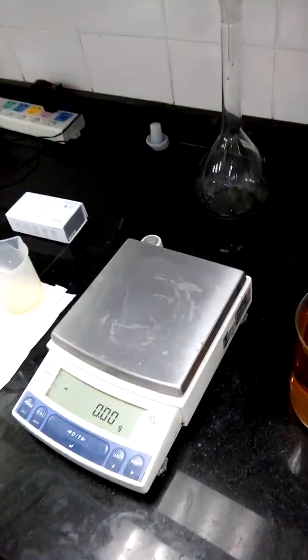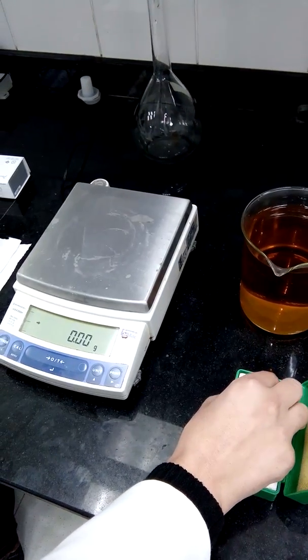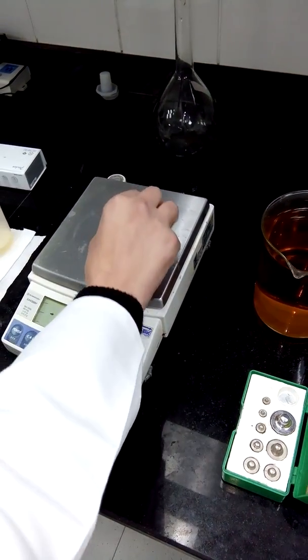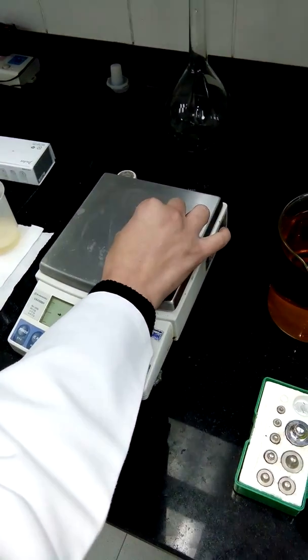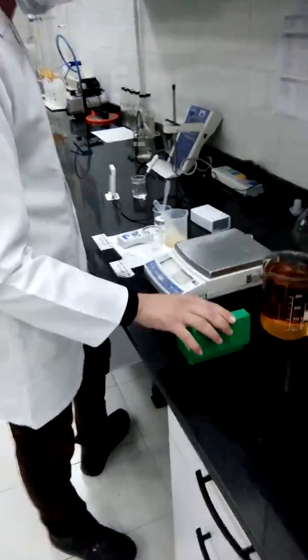For using validation weights, I have to use the lowest weight. So this is one gram. Our balance is ready for use.